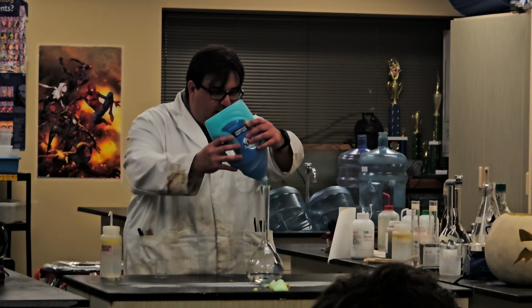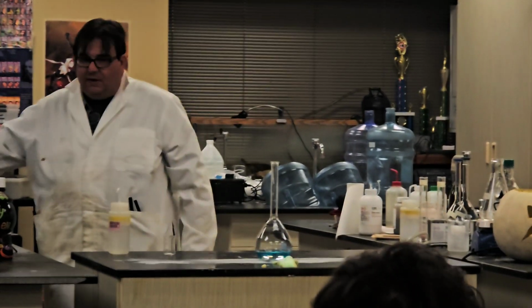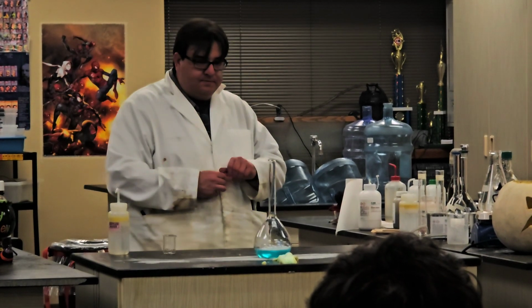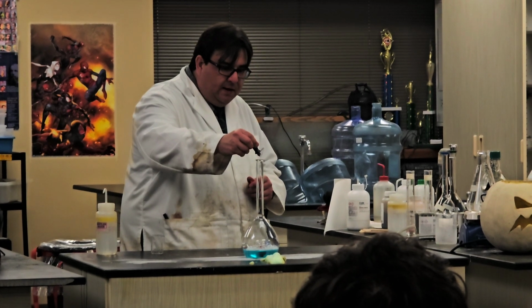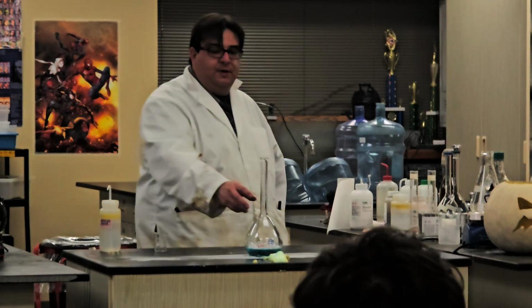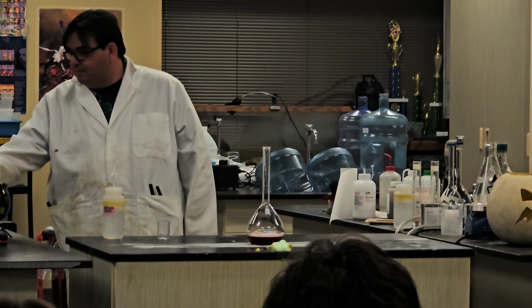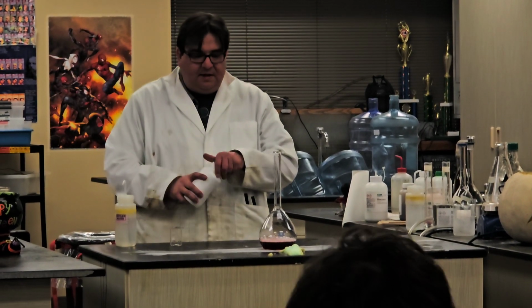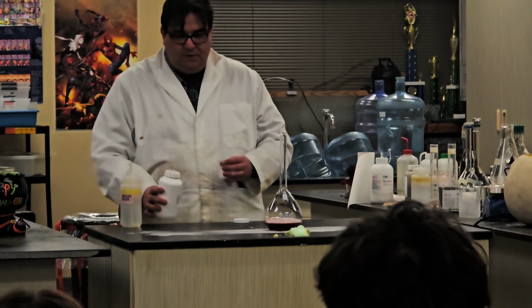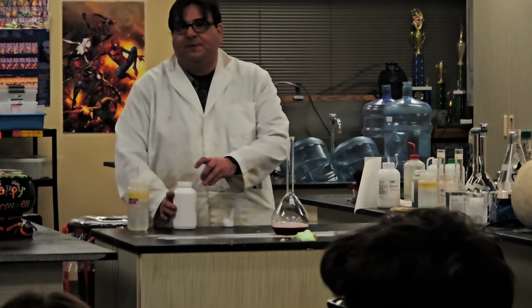That's crazy. So I'm going to do this again, but this time you can actually more so see what was going on. So this is elephant toothpaste. What I use is hydrogen peroxide. It's 10 times more concentrated than the hydrogen peroxide that you can buy at a store. And then I'm using potassium iodide to liberate all of the oxygen as much as possible.